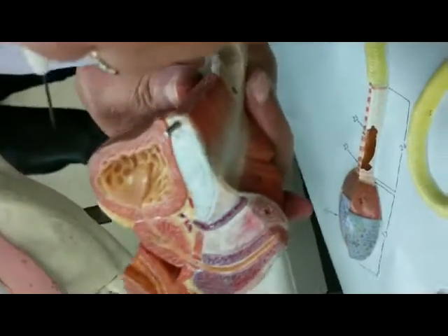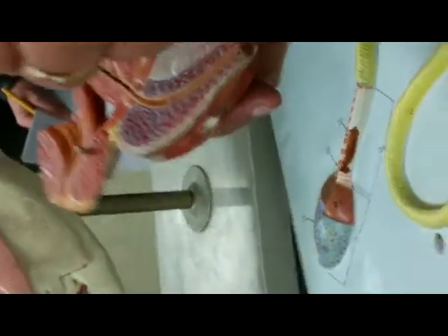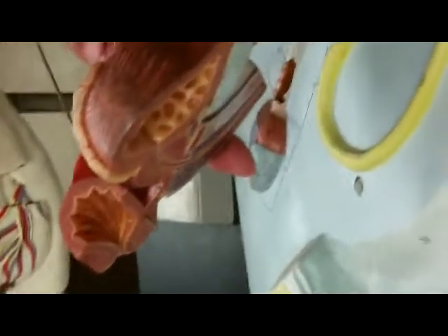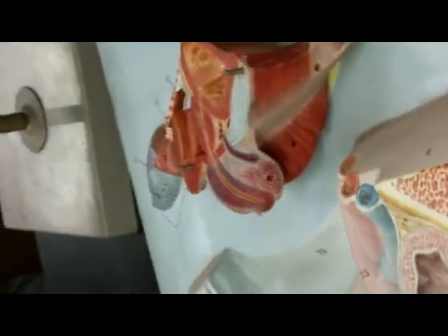And this would be the spongy urethra. You're not seeing the rest of the penis. And this would be the rectum and the anus. So let's look at the other half. Again, here is the urinary bladder. Here is the prostate gland, prostatic urethra, membranous urethra, spongy urethra. Again, this is the seminal vesicle. You're seeing the prostate gland when you cut it in two. Any questions on the male reproductive system?